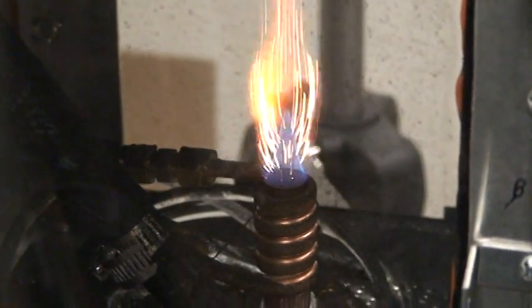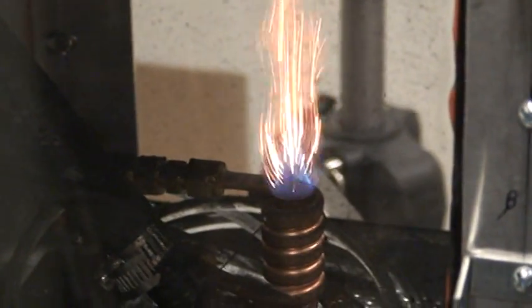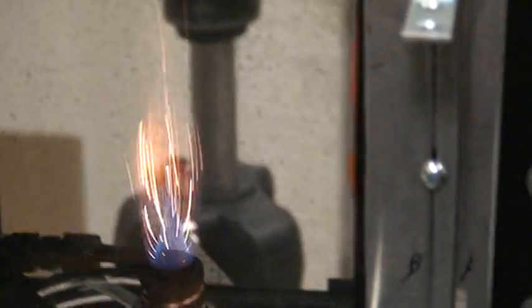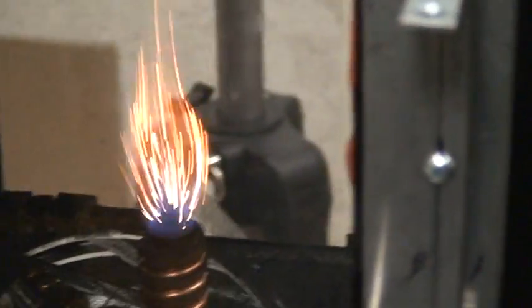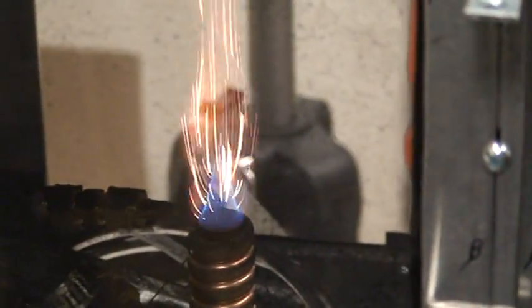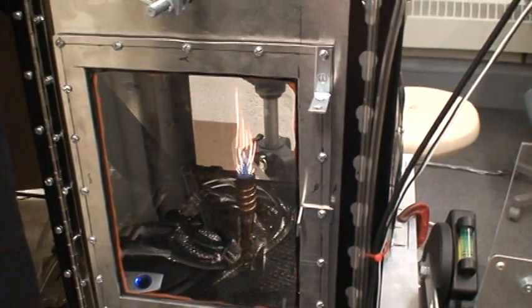Hello everyone. This video is going to talk about a simple Shadowgraph setup that we're using with a combustion system, but you can use it for anything you need to use a Shadowgraph for. So what we have is a simple burner flame. It's just a water cooled burner flame with coal, which is the orange particles burning that you can see.